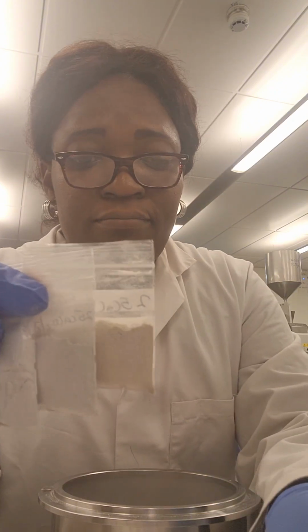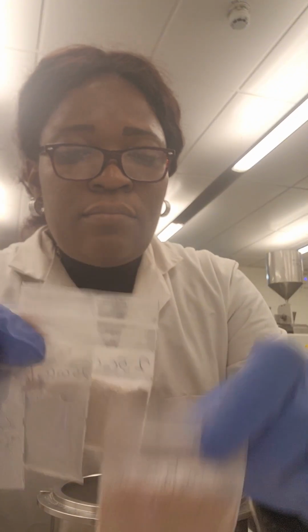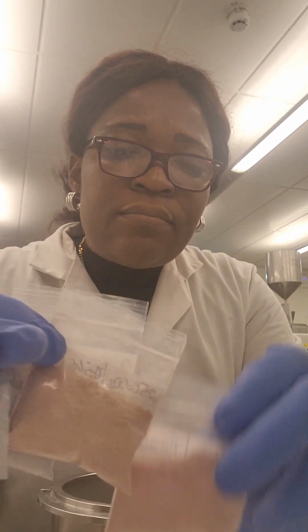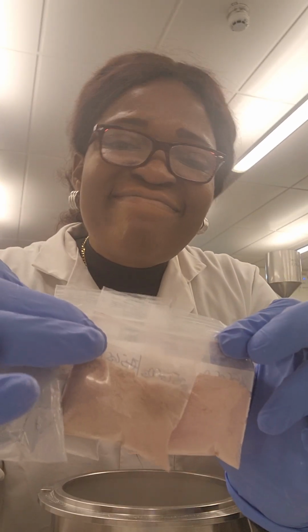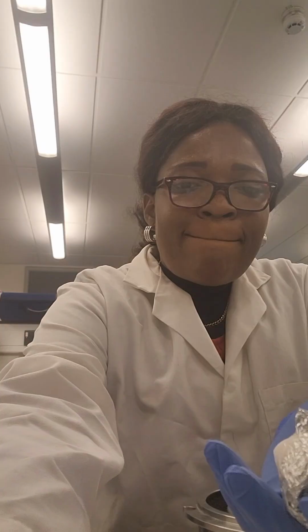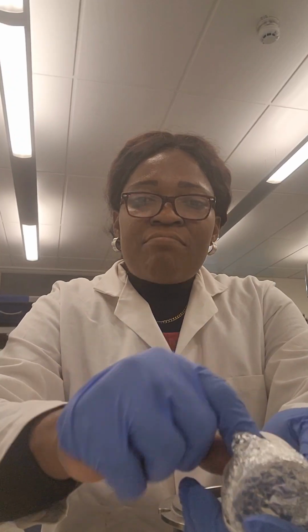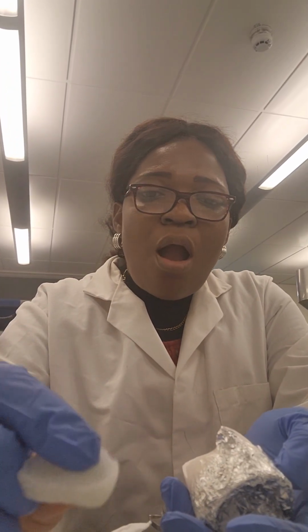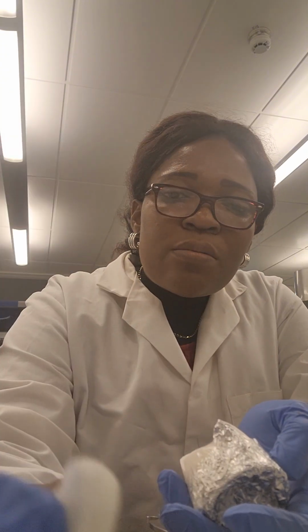You should still see. And then I add 900, and then I add 800, and then I add 700. Oh, you see the color changes. Can you imagine what has happened, considering the things that are present? Anyway, just to keep our day thinking and admiring science.